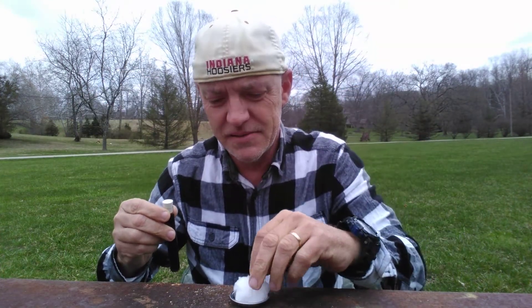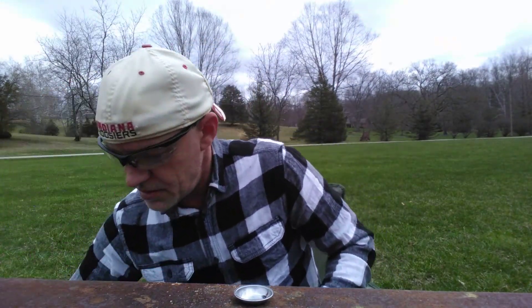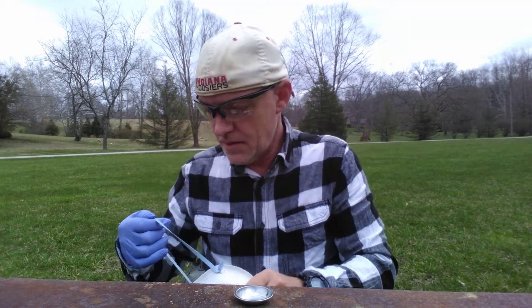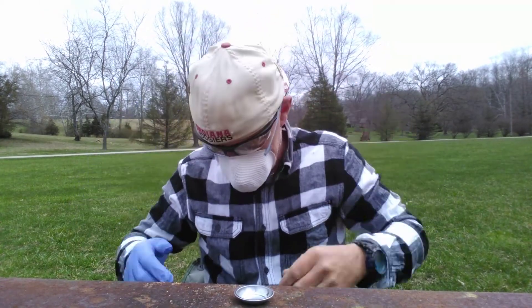So I'm going to put some cotton into this small container here on the table. Before I add the hydrogen sulfate — this stuff is extremely toxic — so I'm going to put on some safety equipment to better protect myself.